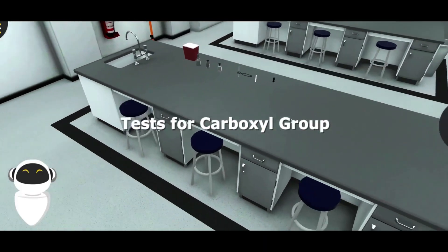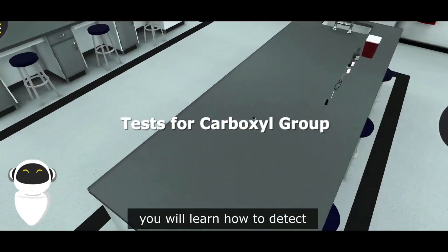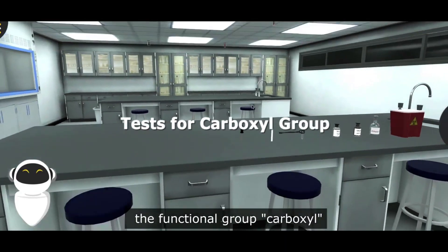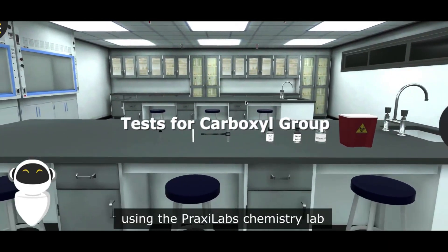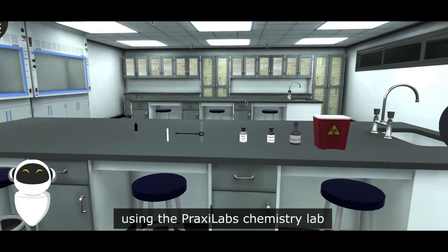Tests for Carboxyl Group. In this experiment, you'll learn how to detect the functional group carboxyl in organic acids using the PraxiLabs Chemistry Lab.